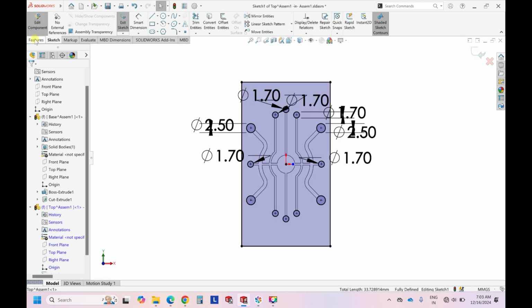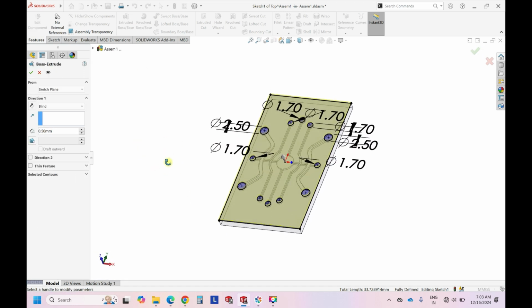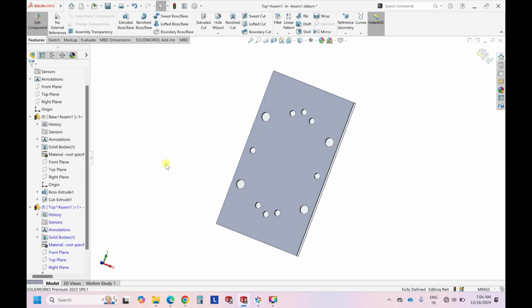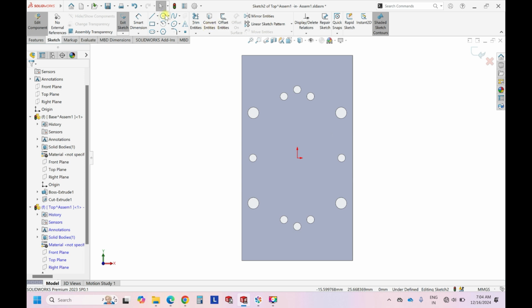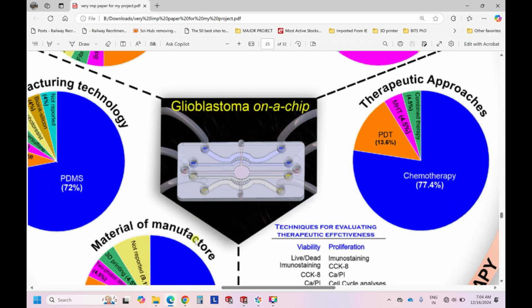Then go back to features, extrude. Now if you extrude, it will come as the opening to the top layer. The top layer we can open as 0.5 mm, which is 500 microns. It is just to close, so that doesn't matter. This is how it comes, right? On the top of it, again we create the outlines. According to this manuscript or review article, it is open, so there is nothing after this.